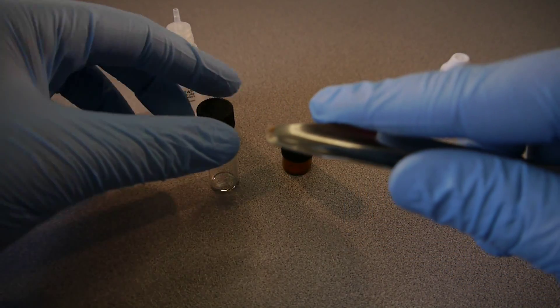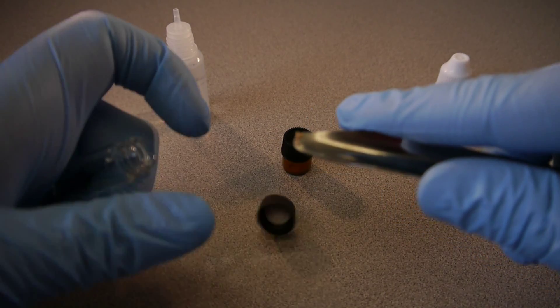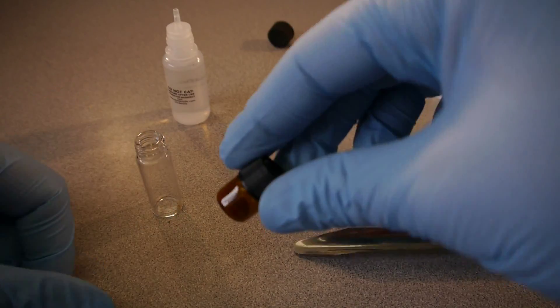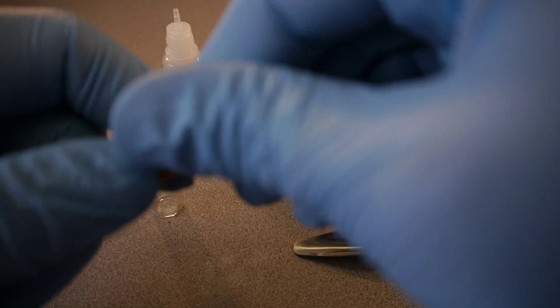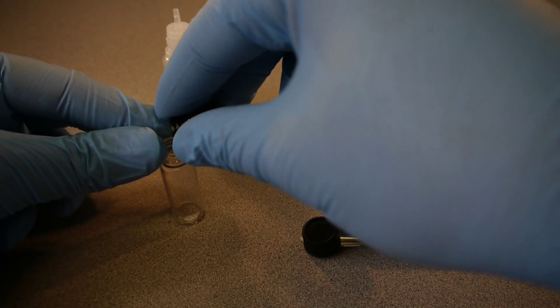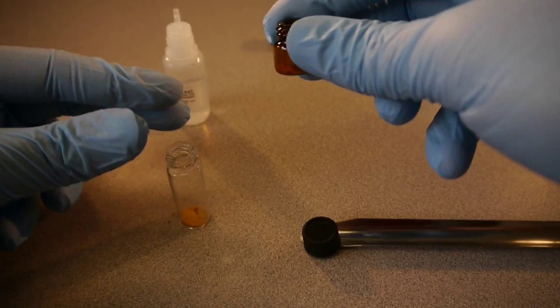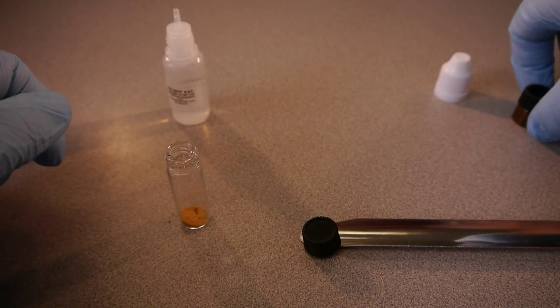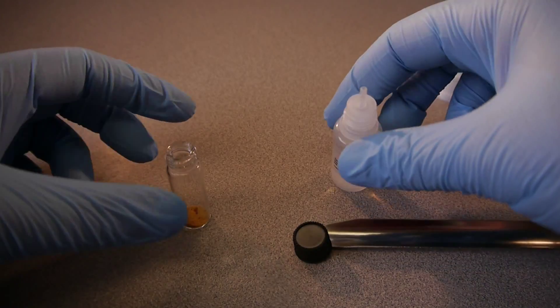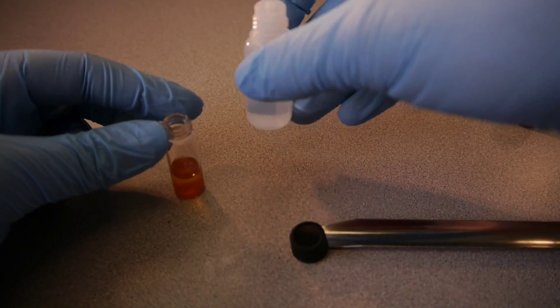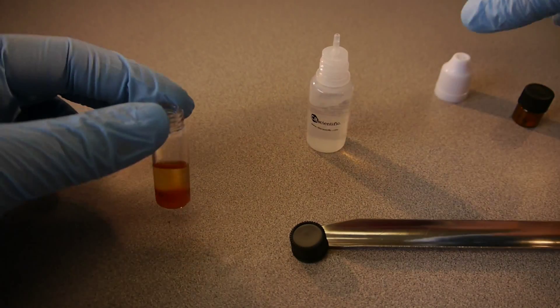So this is, all you need is a very small amount. And we're going to pop the top off of this guy right here, put that in there. We're going to take our dye solution, pop the top off of that, and pour it right inside. Get as much as you can inside it, it doesn't matter if all of it does not get in, but it will lead to a more accurate test if you get most of it inside. It will still be an accurate test if you do not. So, now we get the solvent bottle, and we pour the solvent inside. I would fill up about there. So about there, that's a good amount right there.